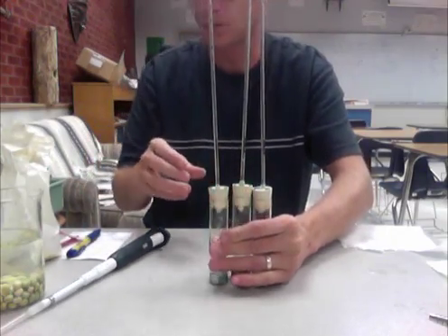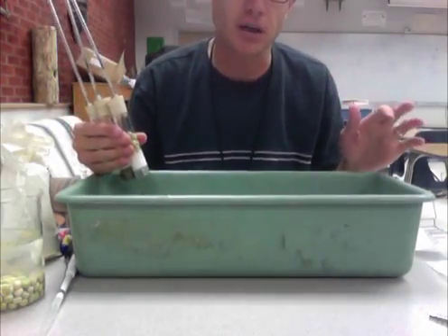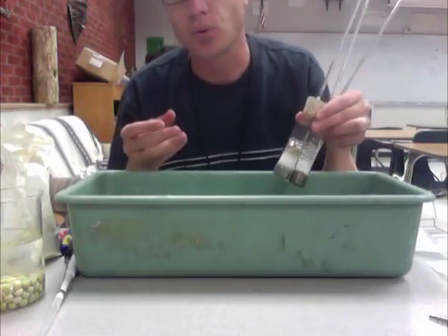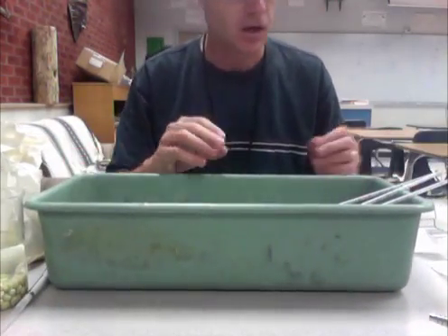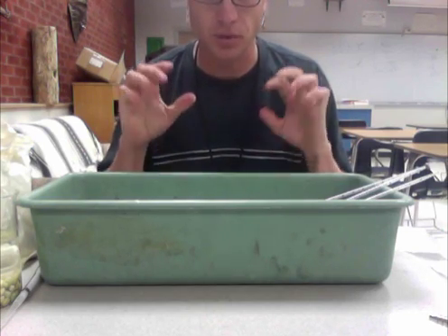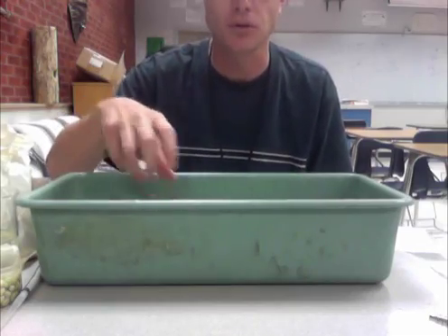Next we're going to measure respiration. Get one of the big tubs and fill it with water at room temperature. Once the water is in, don't touch it or put your hands in — just let it sit so the temperature stays exactly the same throughout the experiment. Next is the equilibration period: take your three respirometers and put them under water with the pipette ends coming out the side. Let them sit for about 10 minutes so the temperature inside the respirometers equals the temperature of the water. After equilibration, lay the respirometers flat in the water, using a beaker of water on top to hold them down if needed.